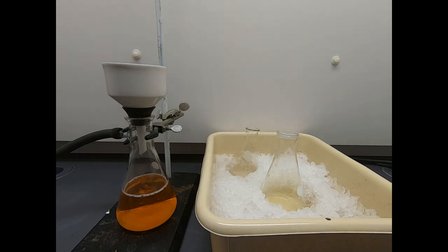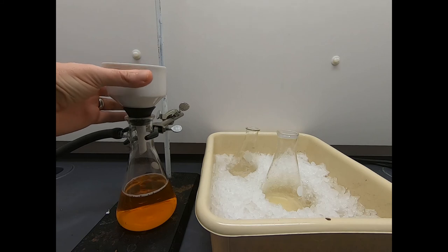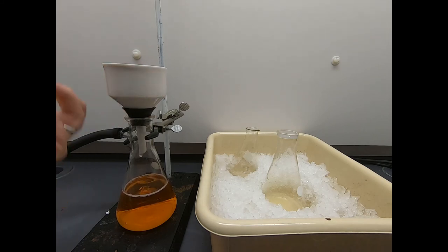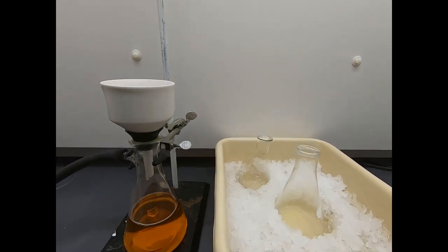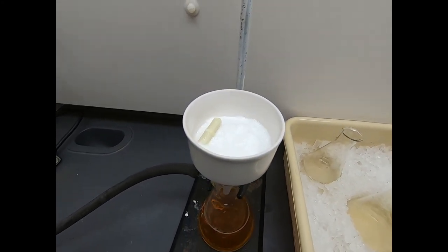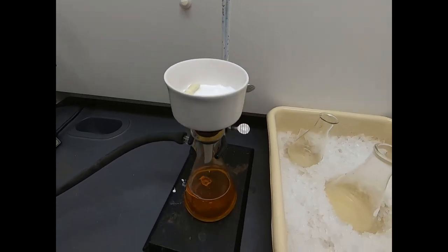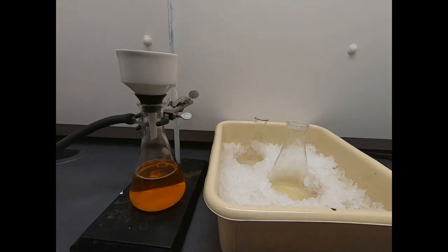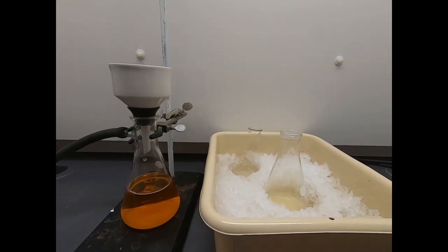Okay, great. So this is now going to filter. We're sucking air through here. This will slowly air dry. Air drying is not something that happens in just a couple minutes. We'll need to let this go. I'll probably leave this overnight. And then when we come back, we'll have the mass of our product, and we'll get to see how much of this beautiful white solid, following the removal of the stir bar, we actually get from our original 30 grams of crude material.